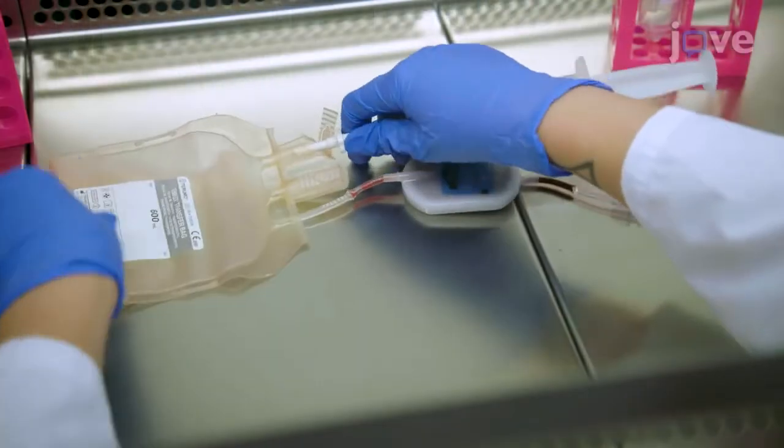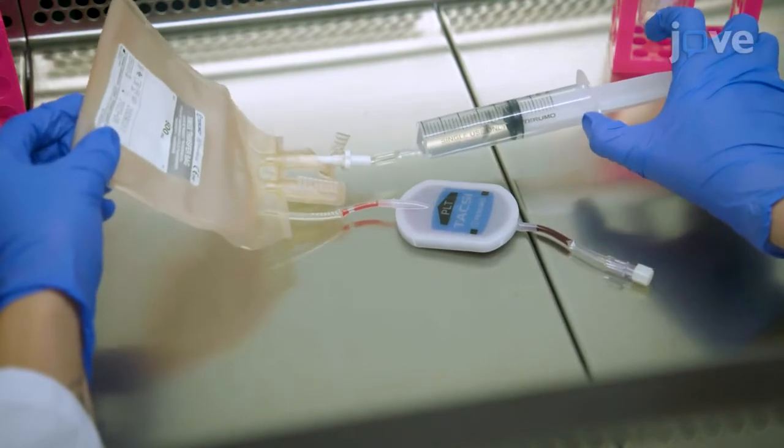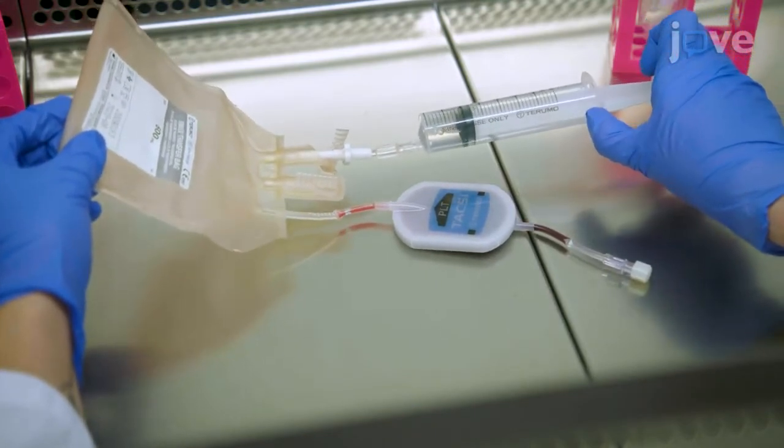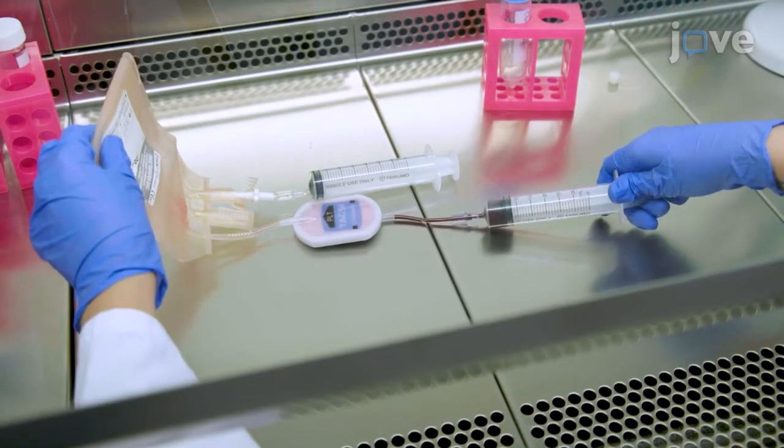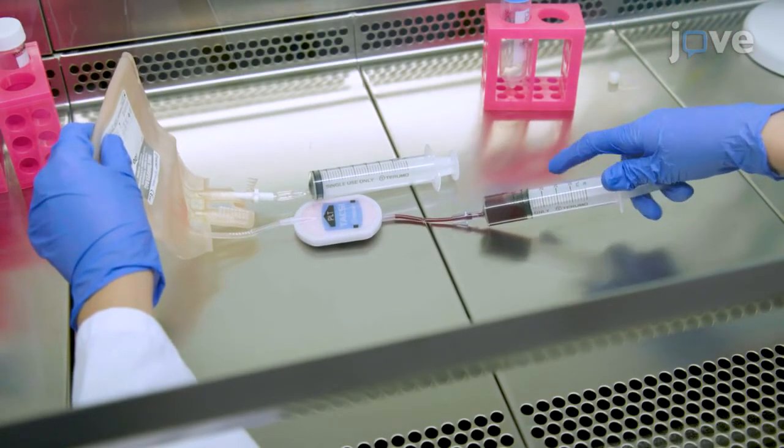In a biosafety cabinet, inject 25ml of filtered elution buffer per Leukoreduction Filter into the empty bag and use a 30ml syringe to gently aspirate the bag contents through the filter.